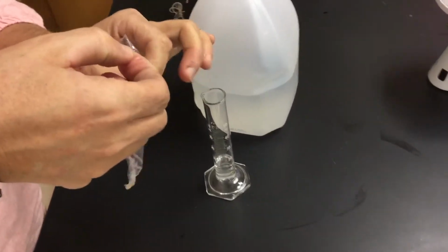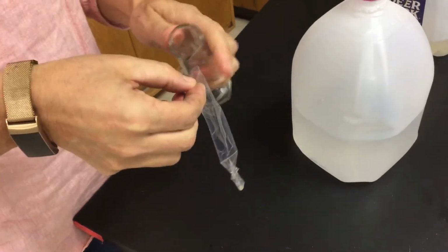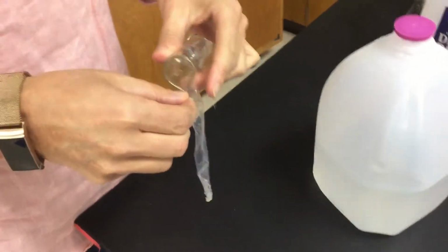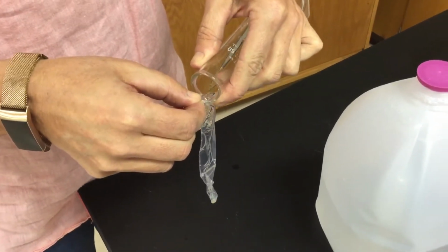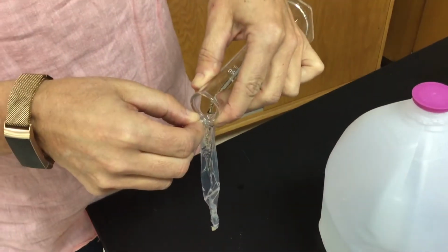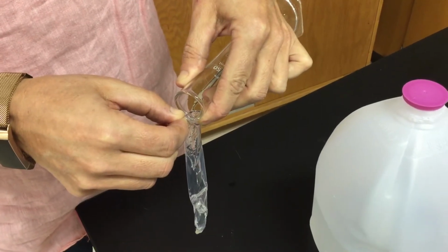So you want to make sure that this is open all the way down. If not, plop it back in the water if it starts to dry out, because we want to make sure that we get all of this solution in here. This is probably the hardest part of the whole lab, is making sure that that pours in there. And you guys should have a little bit of an easier time with it because you'll have a partner in class to kind of help you, hopefully.